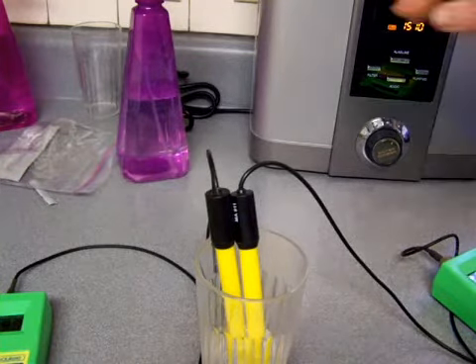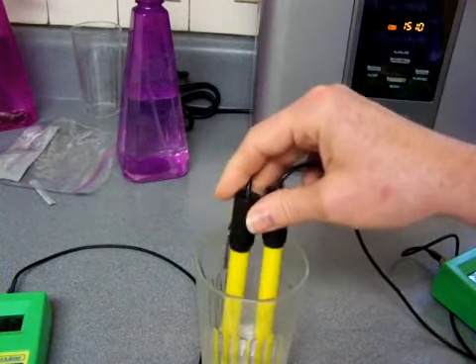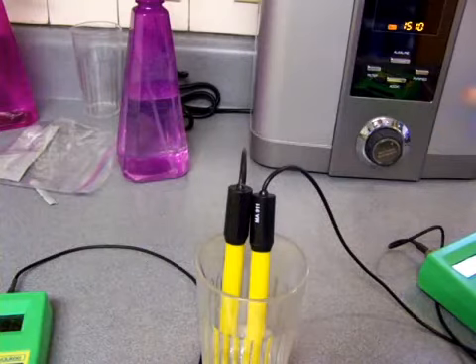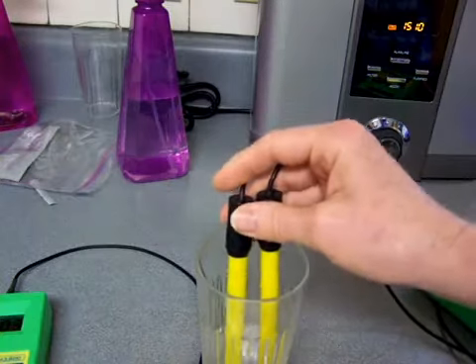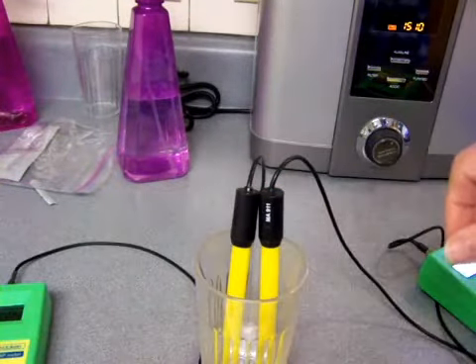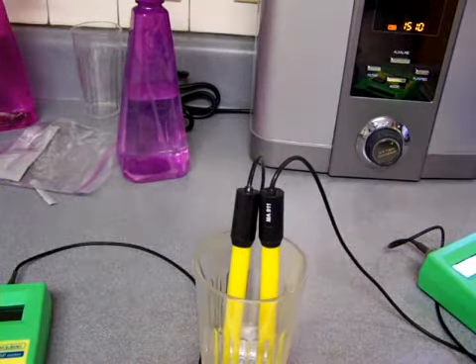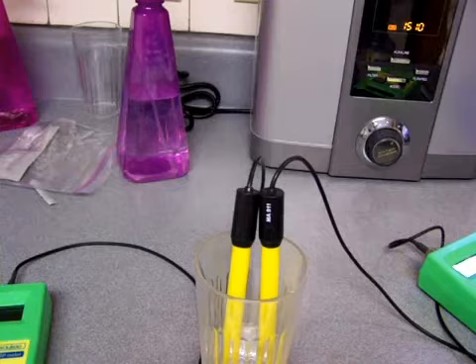The manufacturer recommendations for cleaning these probes are to use their very expensive fluids for cleaning them. Now I have all those various cleaning solutions, and I used to do that long ago, but at this point I do not do that anymore because it just takes too long, and I don't have 2 hours every time I go to test just to waste on cleaning the ORP meter probe.